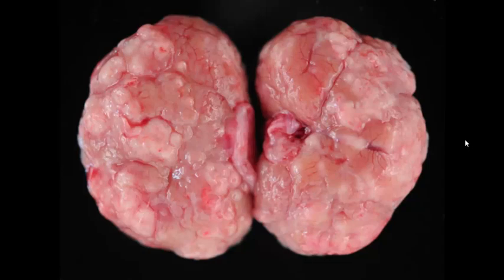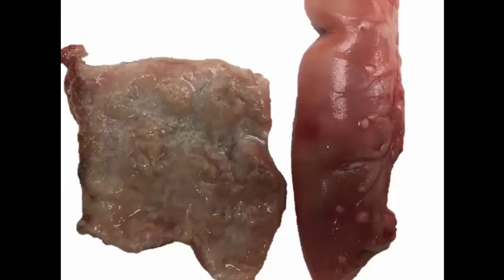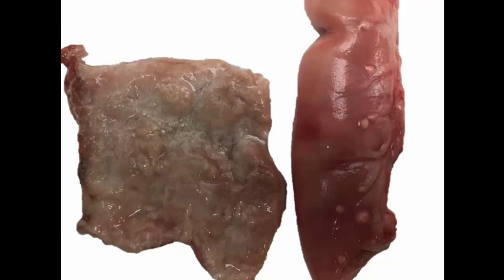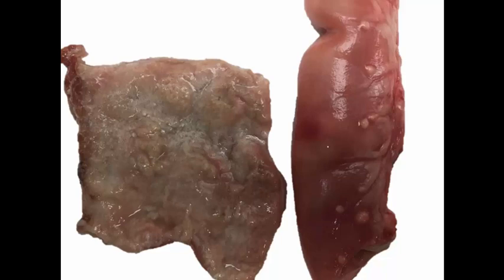Let's move on to slide number three. This is tissue from a dog. I'm going to ask you for a morphologic diagnosis, the name of the condition, and two associated biochemical abnormalities.